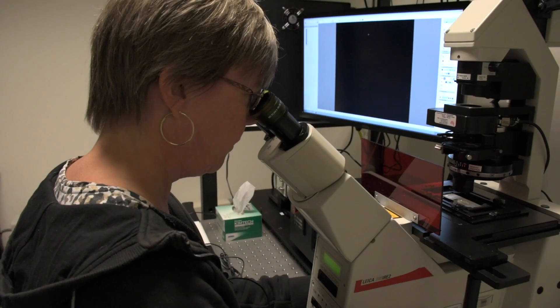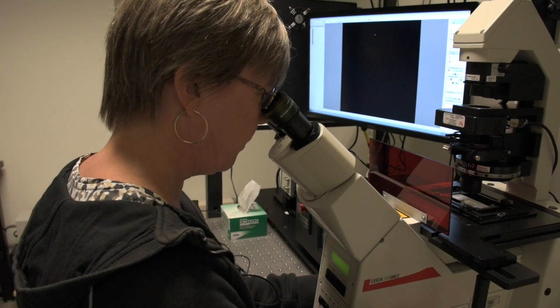In many cases, biological processes or phenomena happen in very fast timescales. When you're taking still images, you might miss these timescales or miss these events essentially. Taking them in real time allows you to capture more detail and really understand what's happening within a cell.